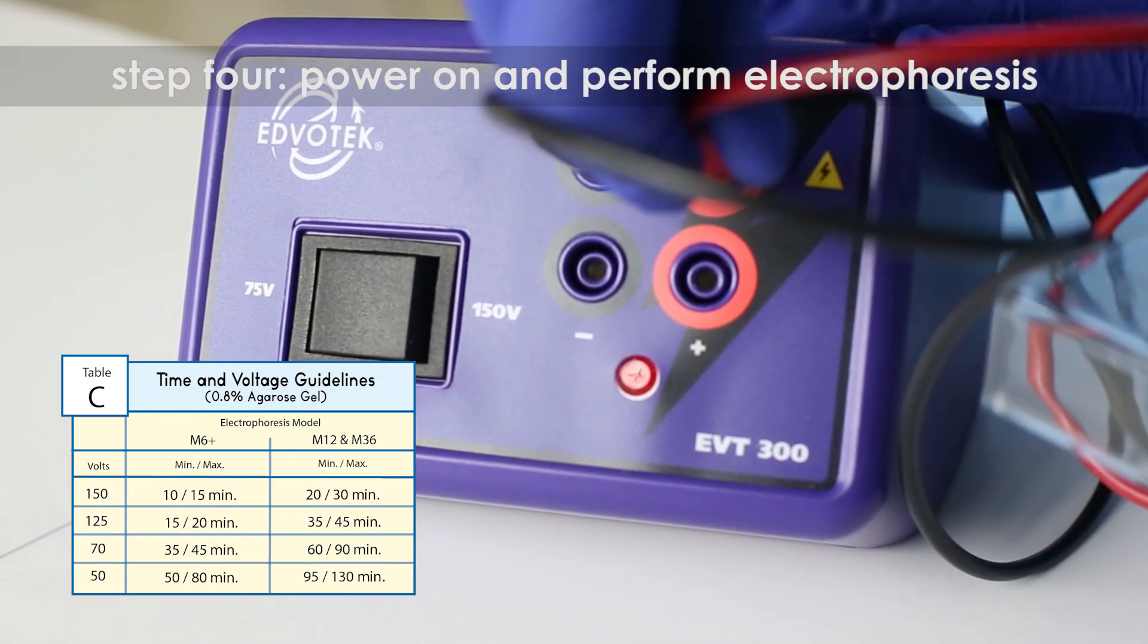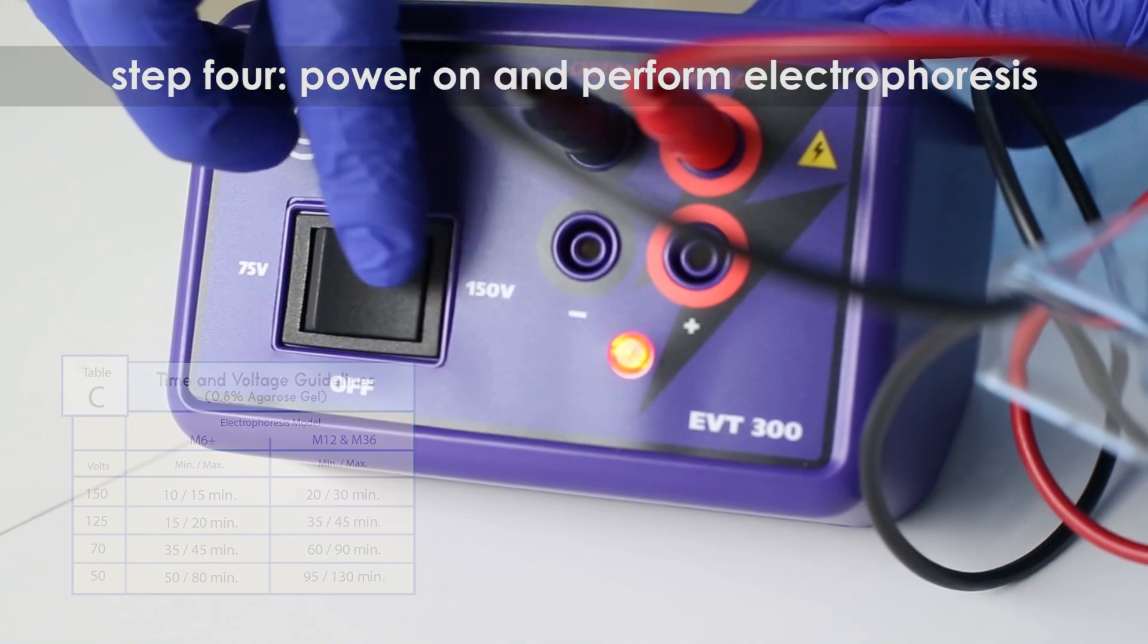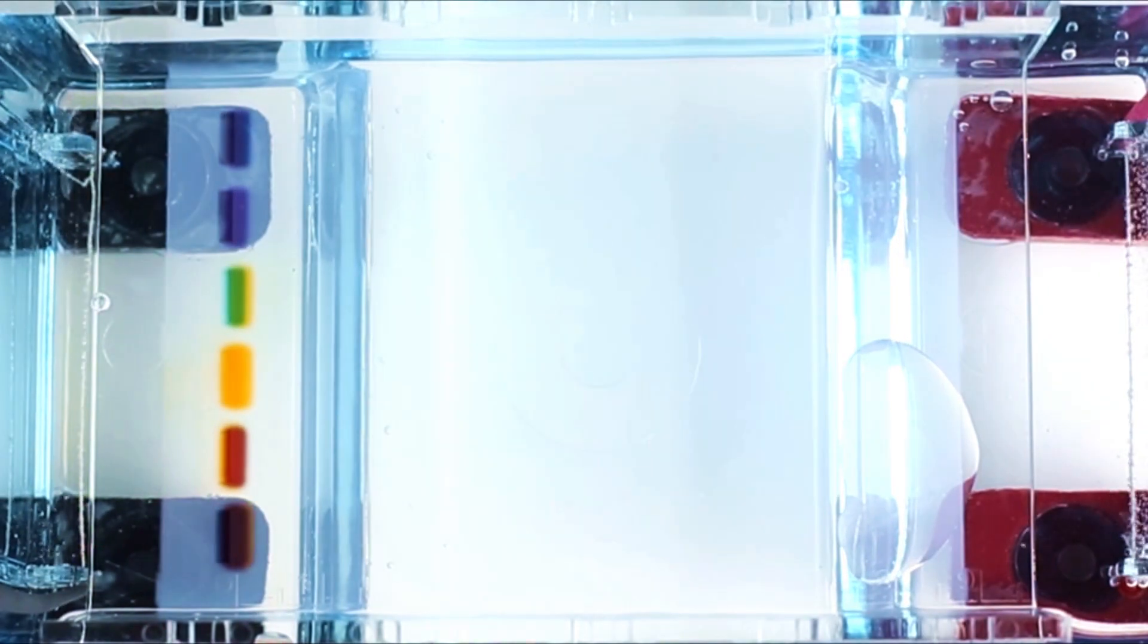Here's a time-lapse of our experiment samples migrating.